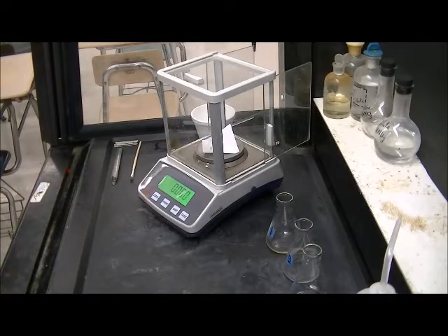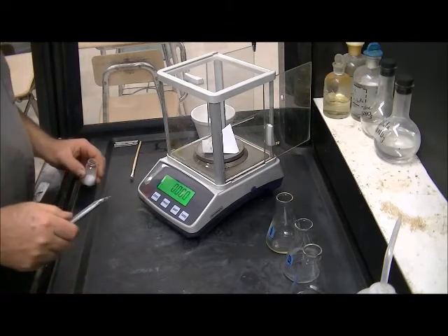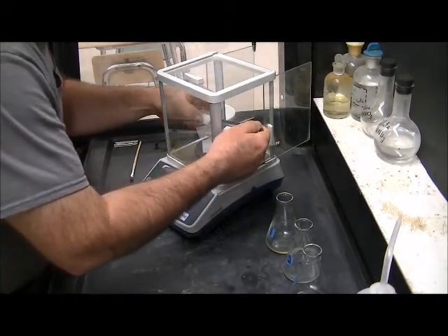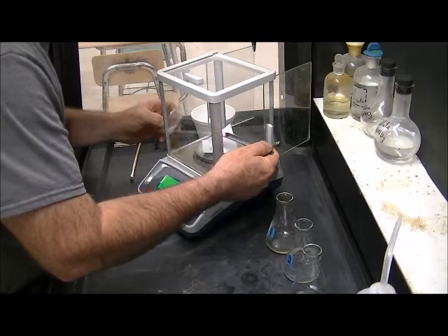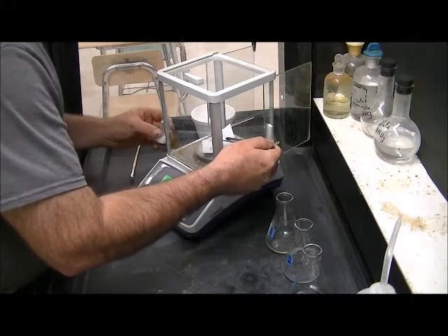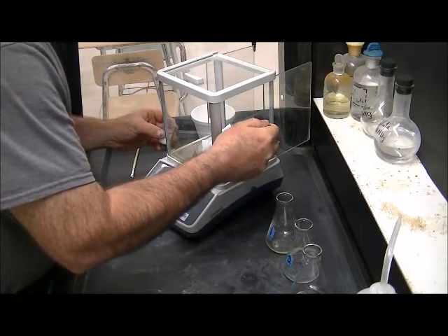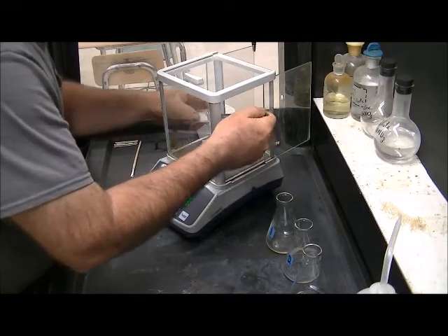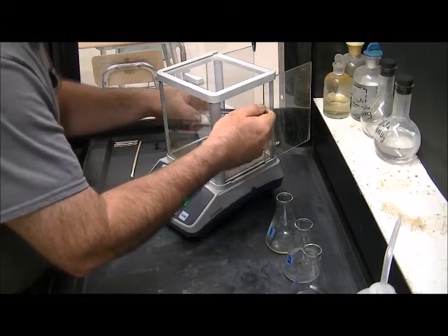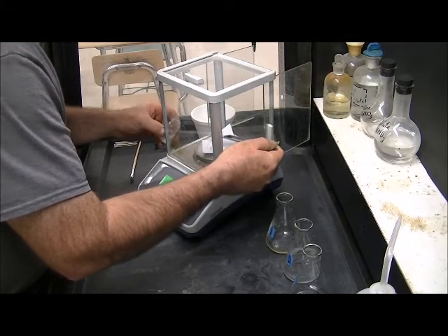I'm going to prepare three samples of potassium hydrogen phthalate to be titrated with our titrant. Our titrant is sodium hydroxide, about 0.1 molar. I need to weigh approximately 0.6 grams of potassium hydrogen phthalate in each aliquot. That has approximately the same number of moles of acid as the ascorbic acid we're going to be titrating in each of our samples.